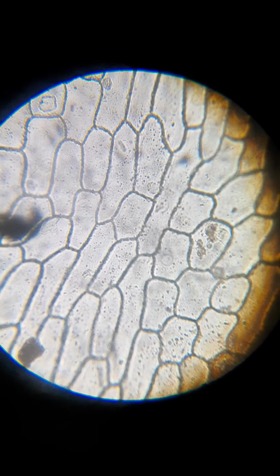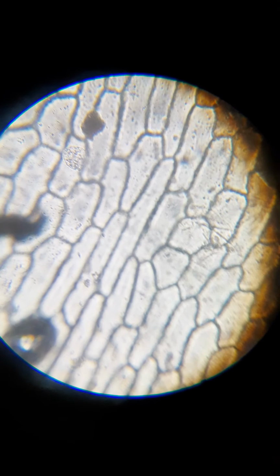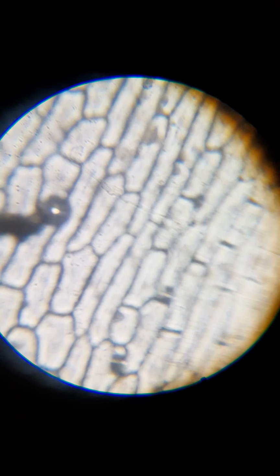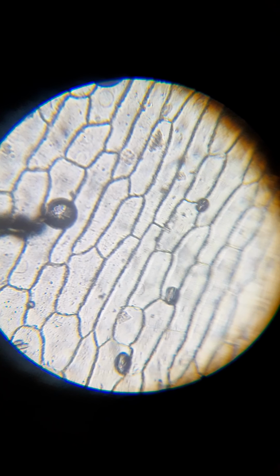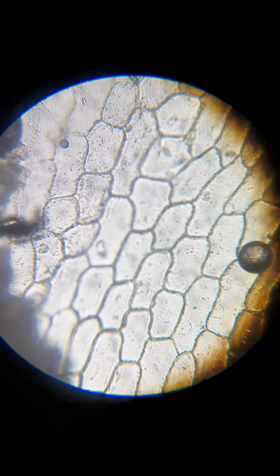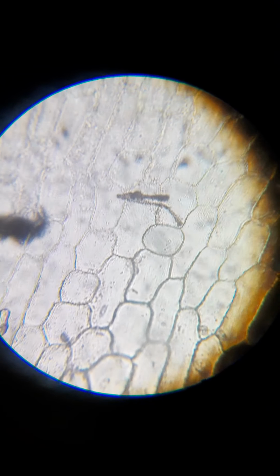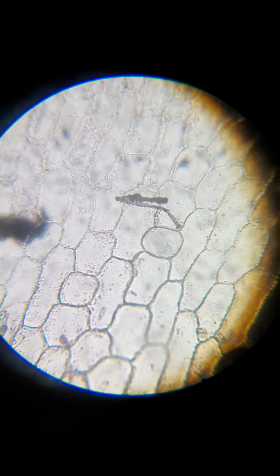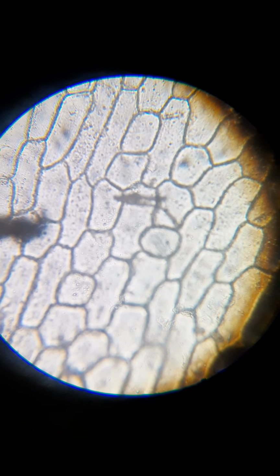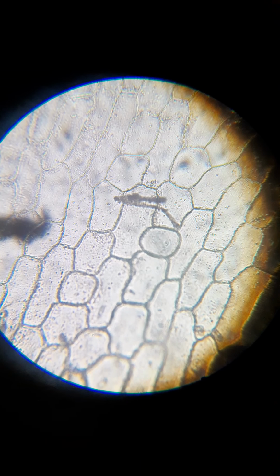All right, I'm going to look around a little bit more here. Refocus. All right. Nope.